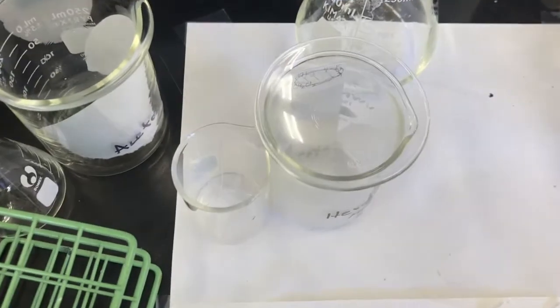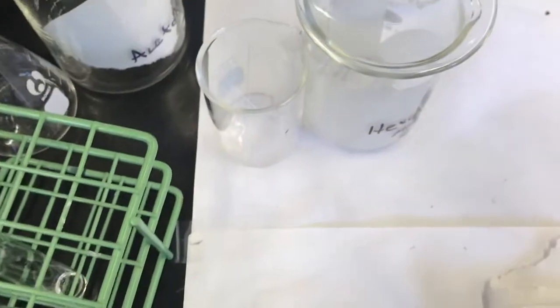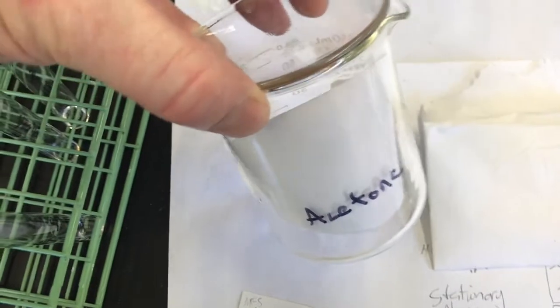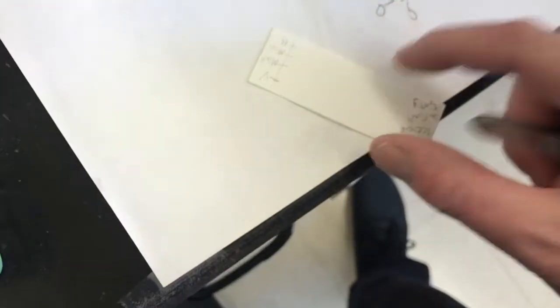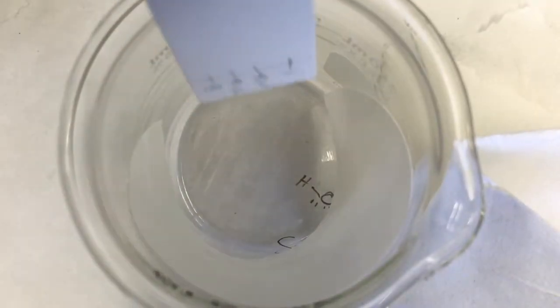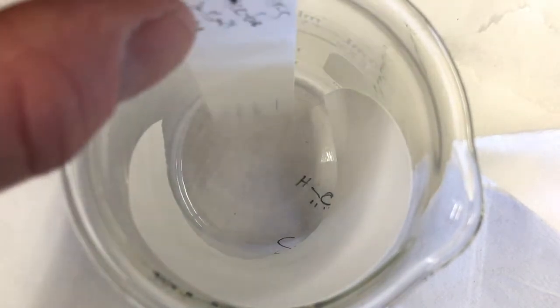Interesting, but I'll spot another TLC plate. Before I run, well, actually, I'm gonna run this one, yeah. I'm gonna run this one in acetone, right? Yes, this one, the spotty one. So I'll open up my acetone chamber and grab my TLC plate. The spotty one, I put spotty on it. And I set it in so that it doesn't touch the wick, it just touches the glass wall. There we go, I think I did a good job.